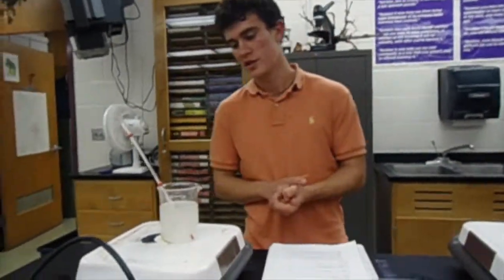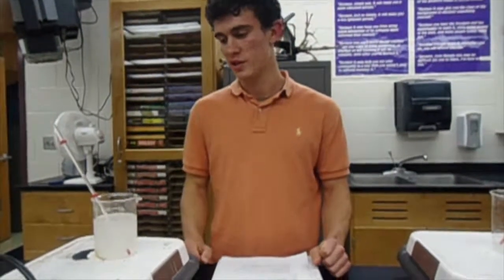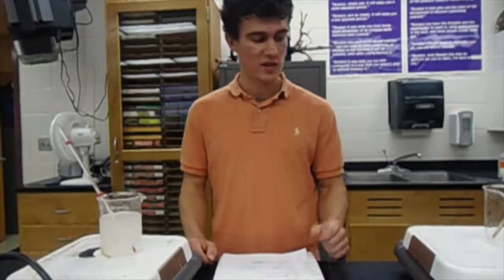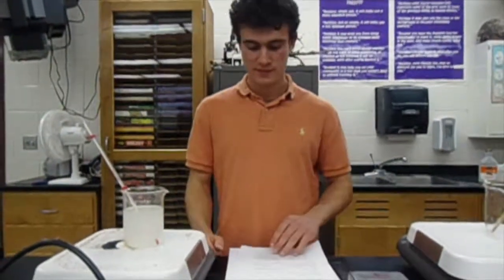This is the outlier, and our hypothesis was correct, but with a little bit of variation. At first it was very rapid and the most efficient. The carbon dioxide built up extremely rapidly, and it was the most efficient at the beginning. This one was a close second. However, at about the 20th minute mark, this one started going down. That's probably just human error because the tube was tilting, but basically the enzymes were not active anymore.